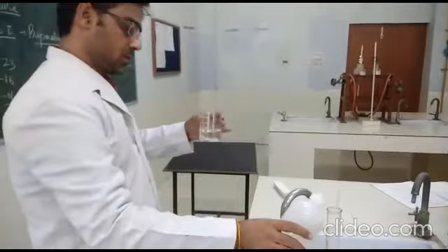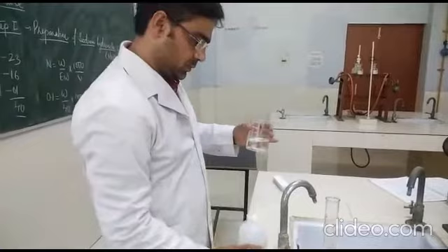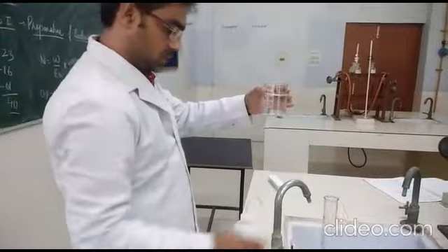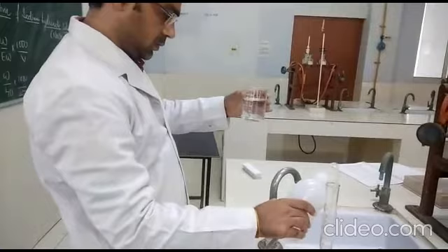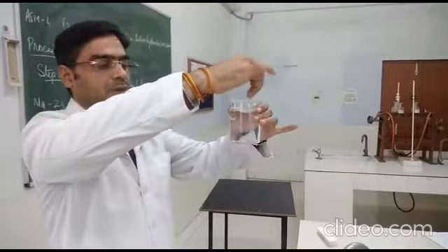Using the wash bottle, we add distilled water to make the final volume up to 250 ml. Now this is 250 ml — we dissolve it to get the sodium hydroxide solution. Our sodium hydroxide solution is ready; we will just keep it aside for 2 minutes.